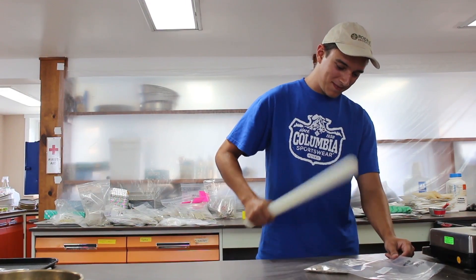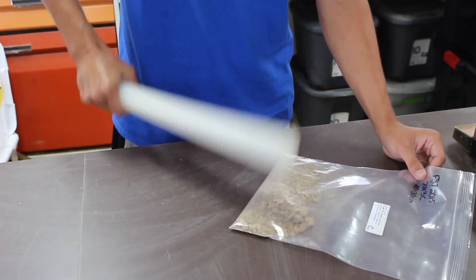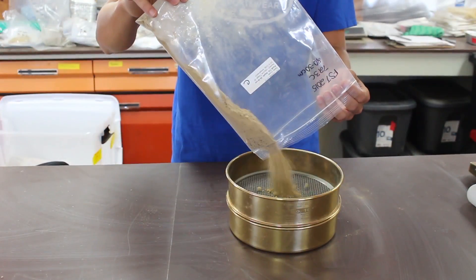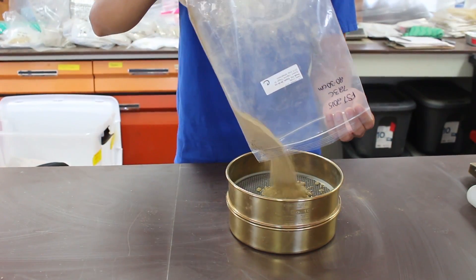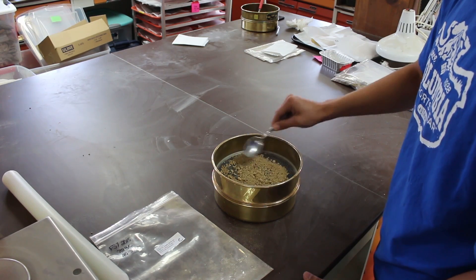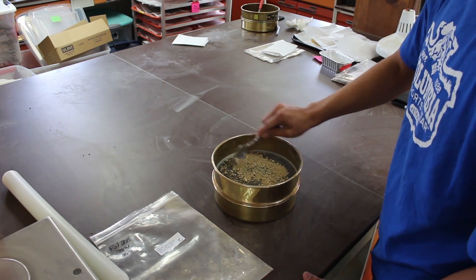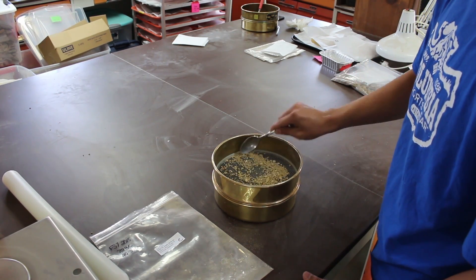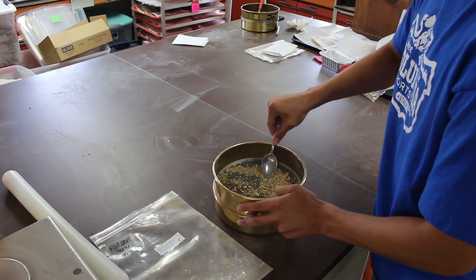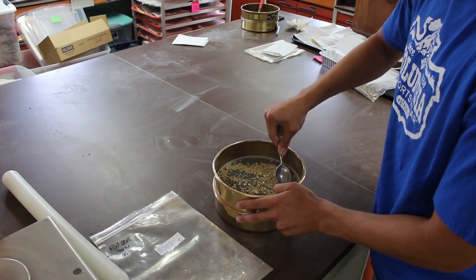As you can see here, Scott, a research intern, is breaking up soil clods. Scott then places the soil into a two millimeter sieve and passes the soil through the sieve with a spoon to separate the rocks from the soil. The more Scott is able to break apart the soil clods, the easier it will be to sieve the soil.